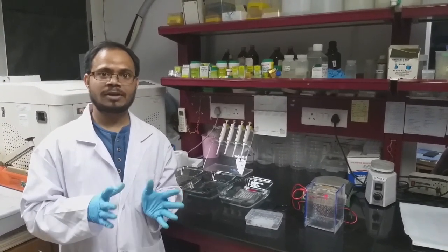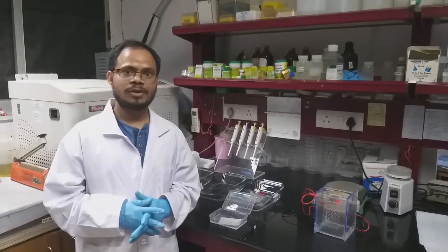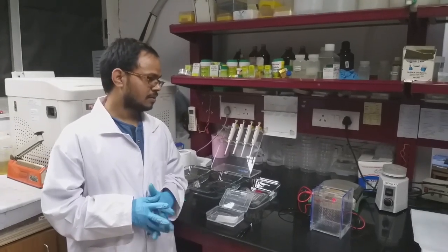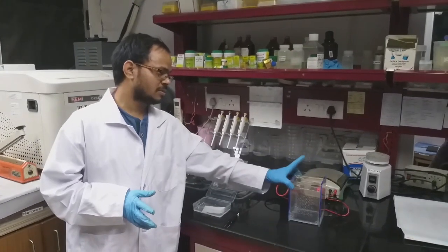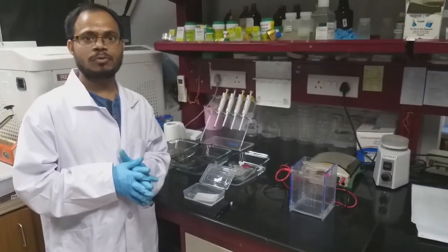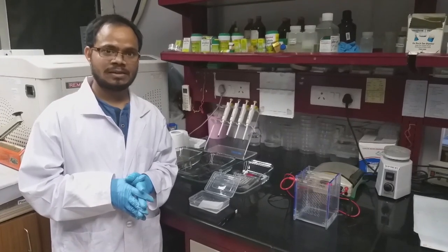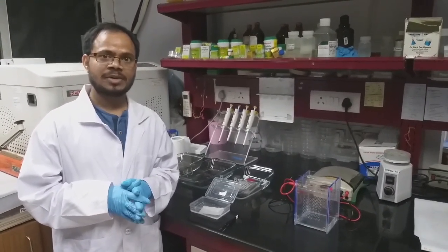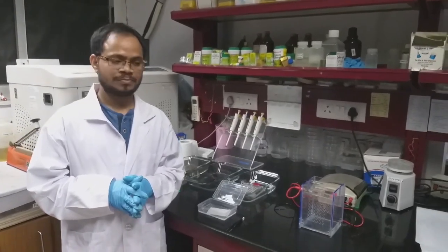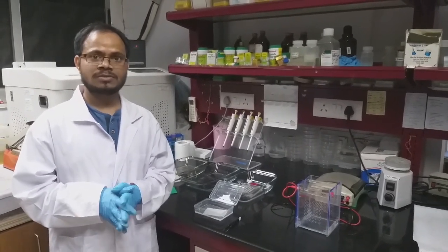In a previous video we already showed how to prepare an SDS-PAGE gel and how to run protein samples. In this video we focus on factors associated with western blotting. For doing a western blot, we need a membrane and transfer buffer. The membrane can be of two kinds: nitrocellulose, which has low protein-binding efficiency and is hydrophilic, or PVDF, which is hydrophobic with higher protein-binding capacity. Processing is different for each type.